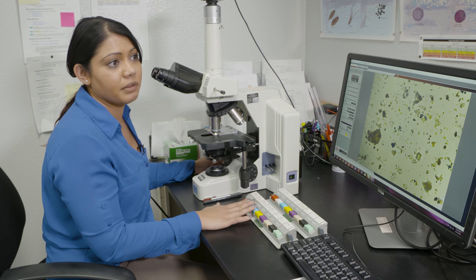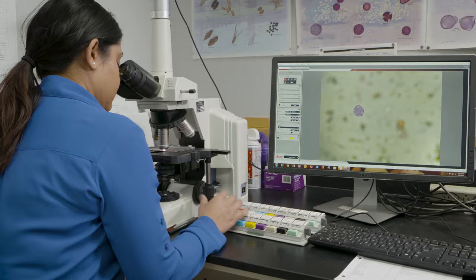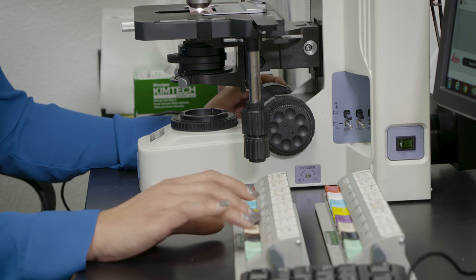Sometimes during peak pollen season you'll see thousands and thousands of them, so we have to use this tallier. Otherwise it would be really hard to keep track of every single one of them.